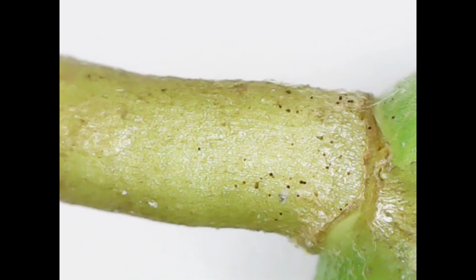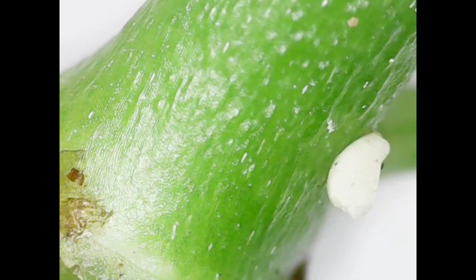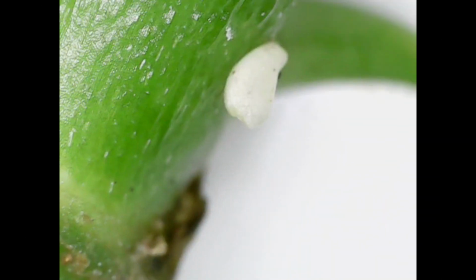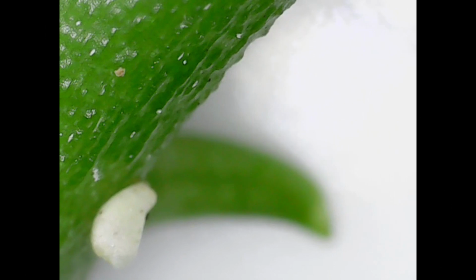But this is quite interesting because a lot of the times we're not always aware that that is there within that root. When we are repotting or moving things around, those hair-like structures on the root are very difficult to keep intact. I don't know what that white little section is there on the stem. I did focus on it for some moment. It's definitely not a bug. It might be a chunk of perlite, but I'm not entirely sure.